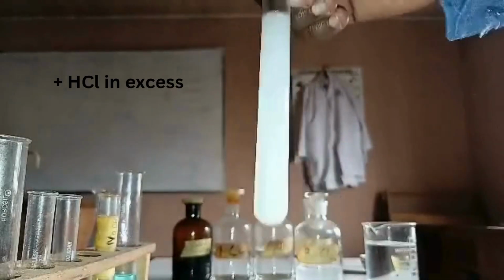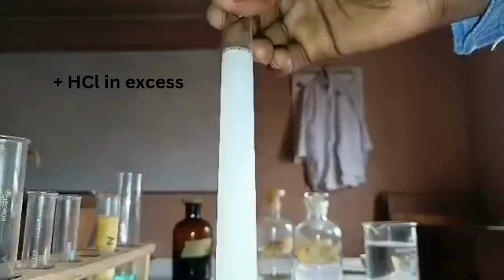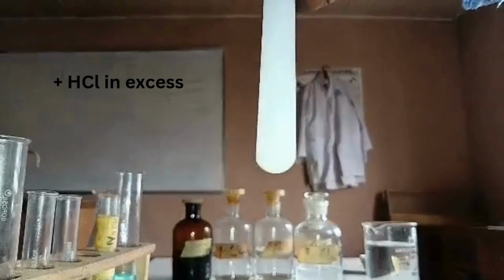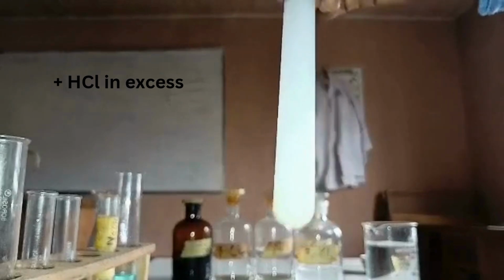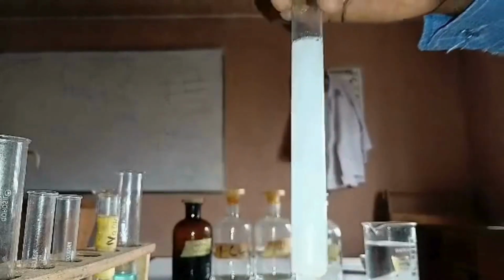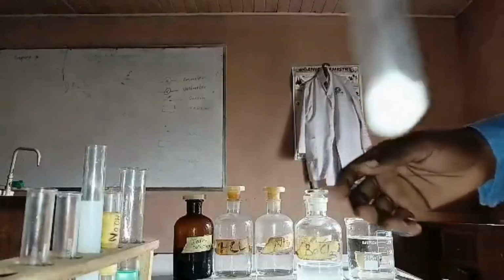On adding hydrochloric acid in excess, the precipitate was insoluble in excess of hydrochloric acid, as we can see, indicating the presence of tetraoxosulfate(VI) anion.